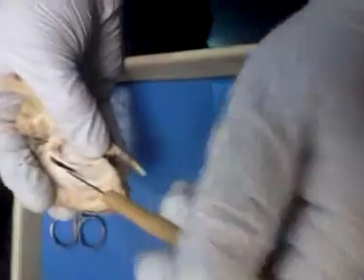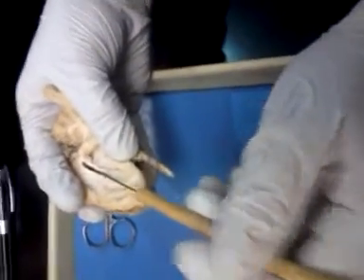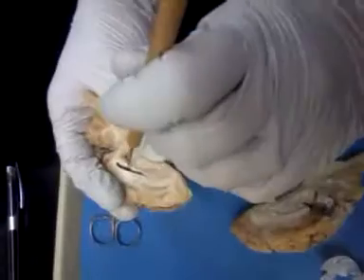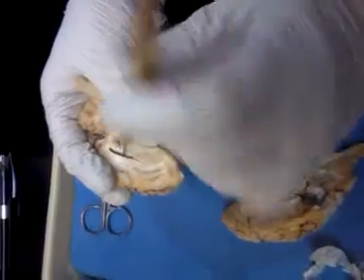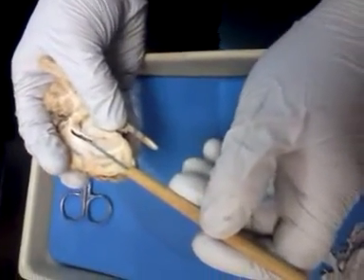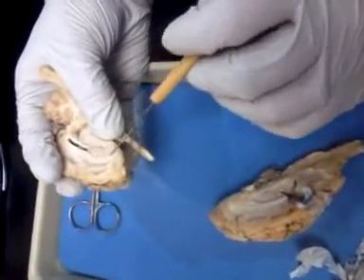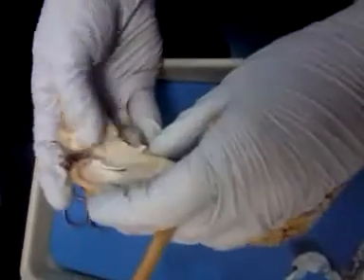Okay, that's not it. That's your choroid plexus. Those are the cells inside that produce cerebrospinal fluid. Okay, so if it's sticking straight in like this, they want lateral ventricle. If it's sticking sideways and it has like a membrane over it, it's septum pellucidum. This white part that comes above the lateral ventricle is your corpus callosum.